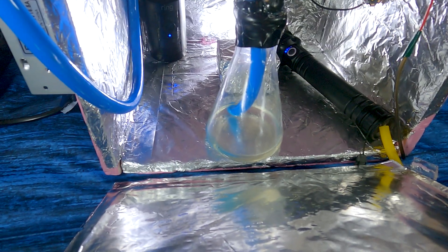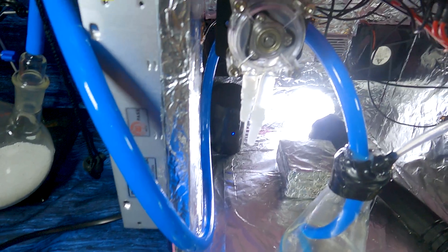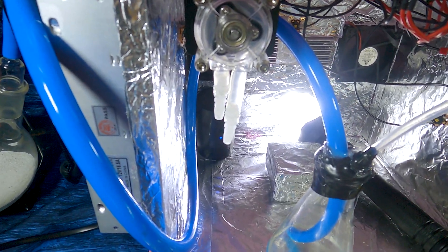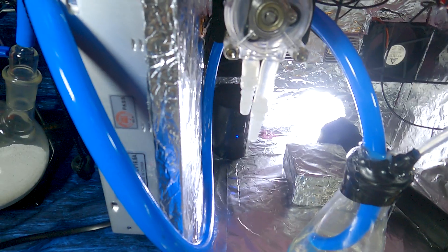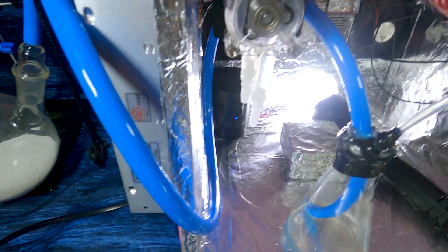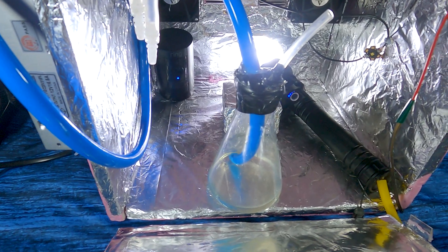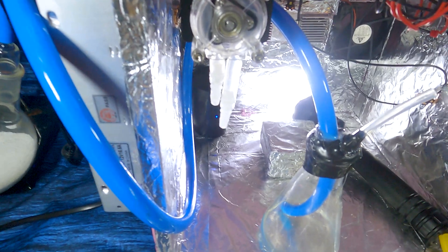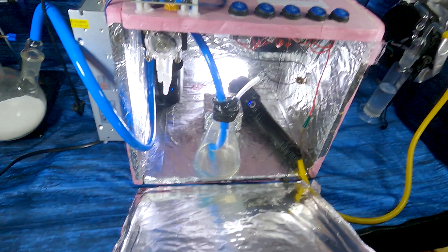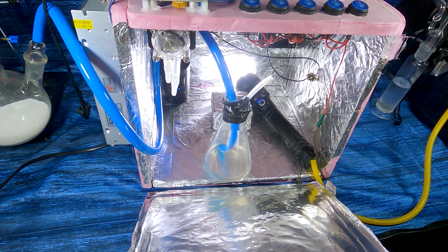There was also sealant on there called Magic Tape — chloroform ate that too and clogged up the pump. I'm glad that happened, because we do need this reliable and working for the FEP tubing — that's the main purpose. I'm going to work on the connections from my FEP tubing to those little ports, but for now we're just going to try it as a regular batch reaction and see what happens.